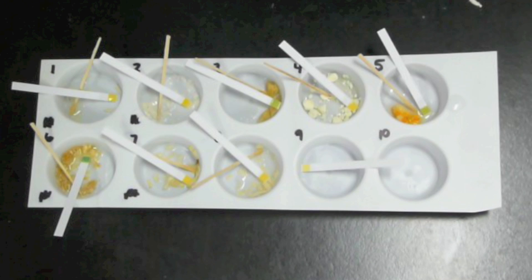Pause the video here, make your observations, decide on your test results, and then move on to the next section.